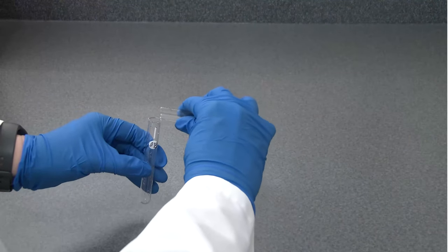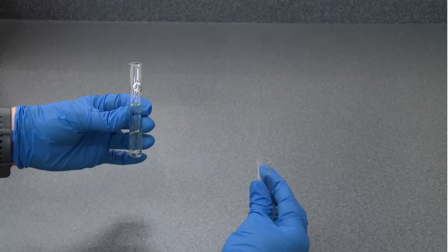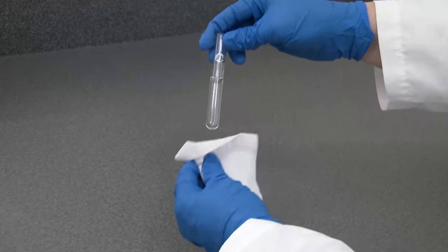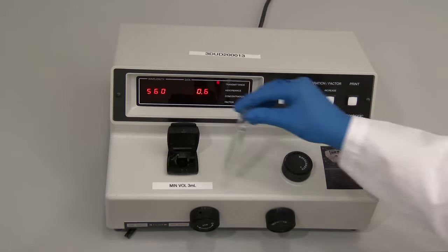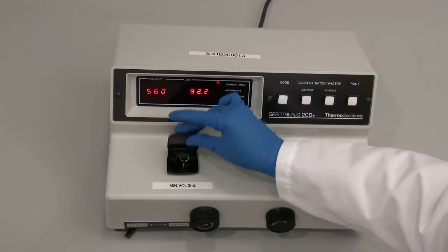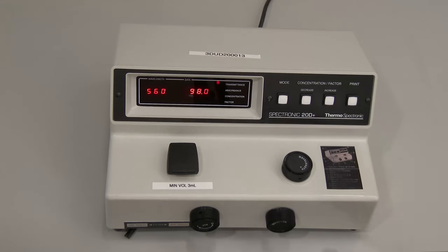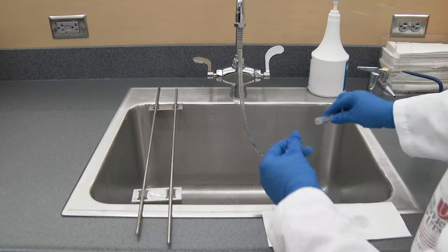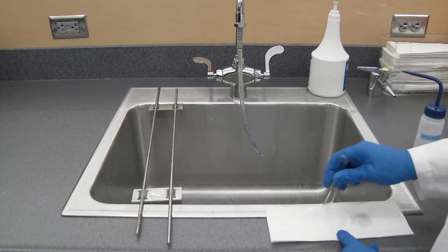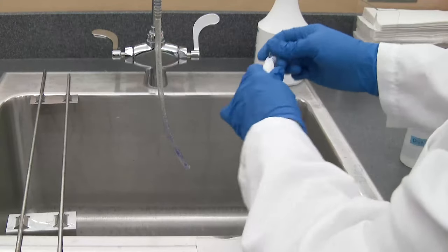To measure the transmittance or absorbance of a sample reaction, fill a clean cuvette with at least 3 milliliters of the solution, avoiding formation of any bubbles. Use a lint-free tissue to wipe the outside of the cuvette and insert the cuvette into the sample compartment, making sure to align the guide marks. Close the cover and record the percentage transmittance or absorbance from the digital display. Remove the cuvette and appropriately discard the sample reaction. Rinse the cuvette three times with distilled water, tap on paper towels, and wipe with a lint-free tissue. Repeat this process for all remaining samples to be measured.